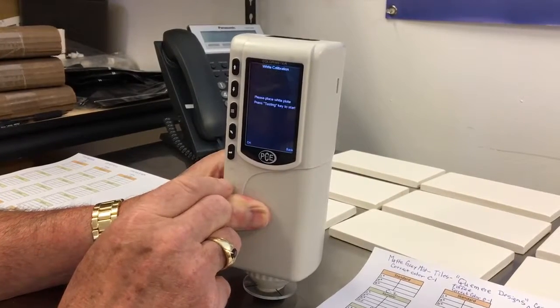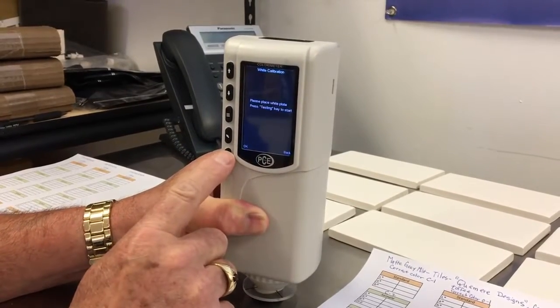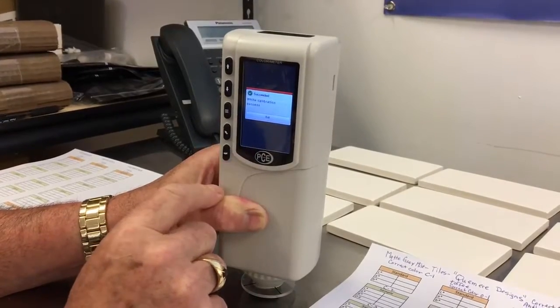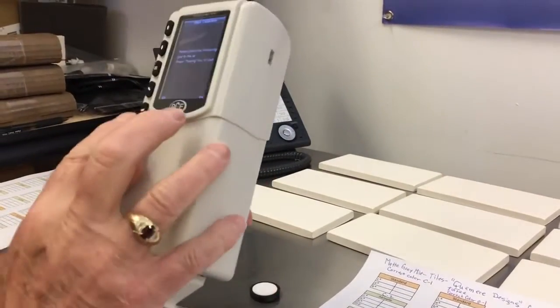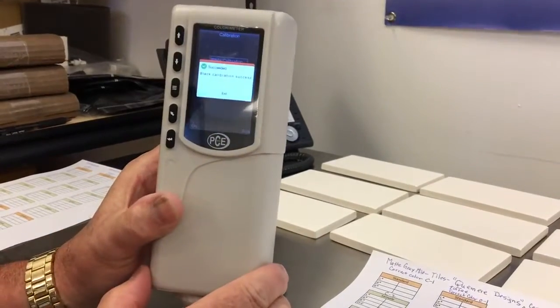Calibration. We press Enter. This is placed on the white space — we're doing so. Enter. Calibrating. Succeeded. White space is good. Now we're going to black. For black all we do is press Enter, then we hold it in the air. Success.